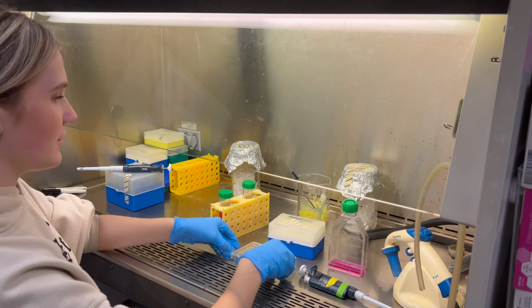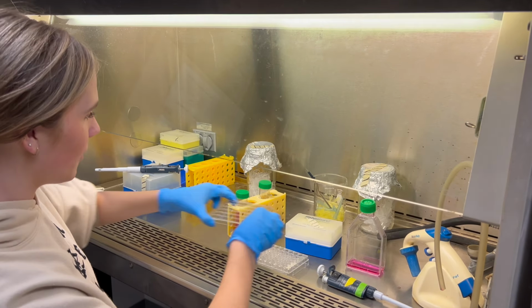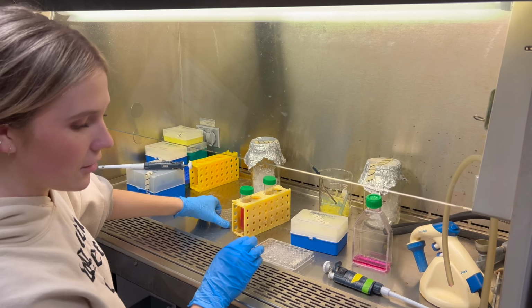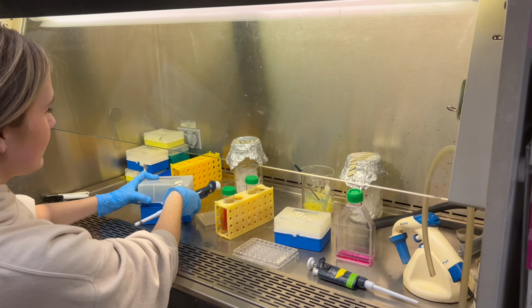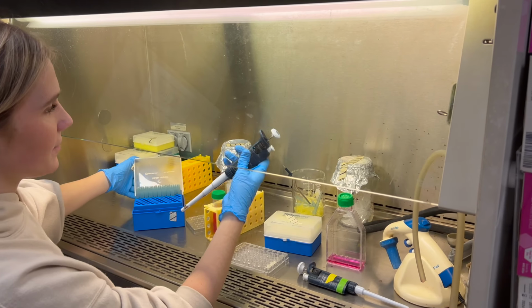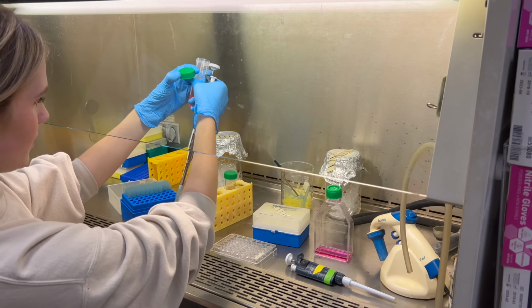And then once it's mixed, we decided that we were going to put 1.25 milliliters into each well. And since we don't have a serological pipette that's that small and we don't have a pipette that is that large, we decided that we were going to go in twice for each well and pipette in 625 microliters. And whenever you're pipetting into your well plate, make sure that you skip a column of wells so that you don't have any bleed over.